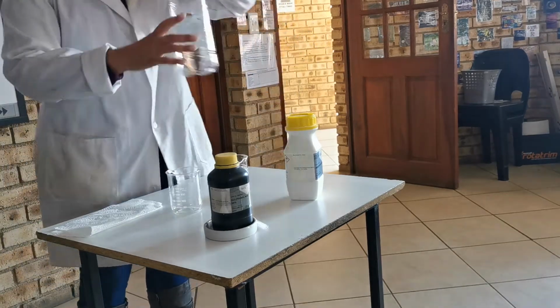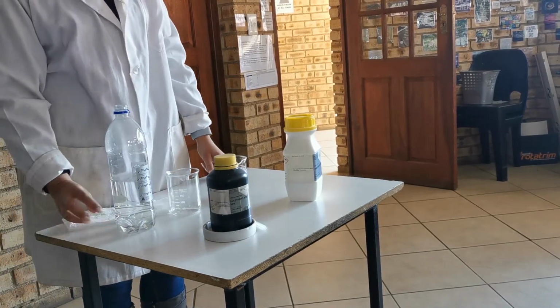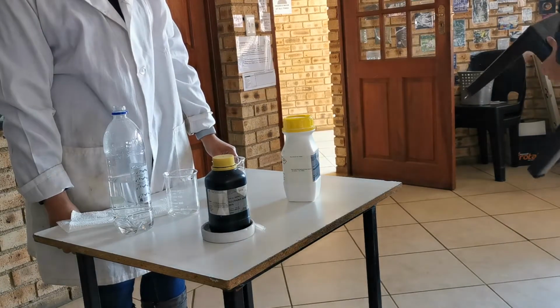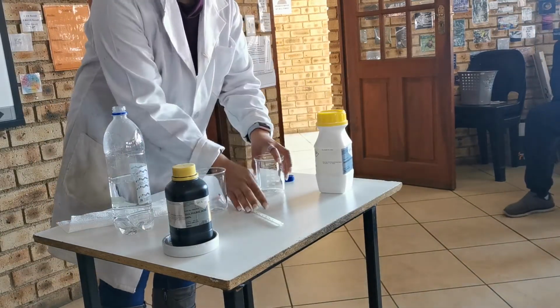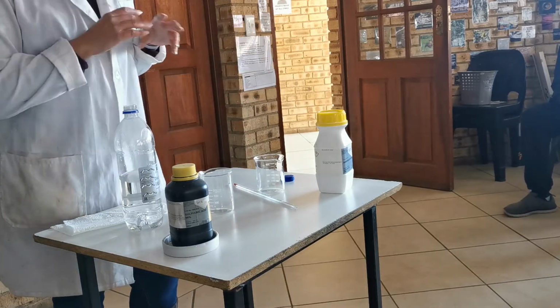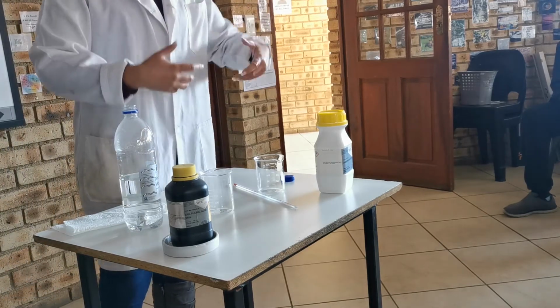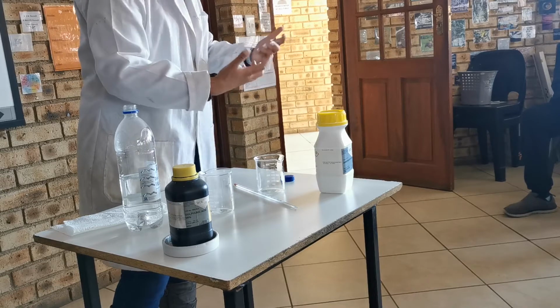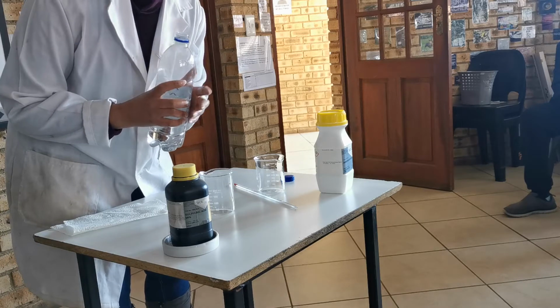So what I have is some distilled water. The first reaction that I want to do is show you an exothermic reaction. An exothermic reaction is one where heat is given off to the surroundings. That is the definition for an exothermic reaction, whereby we have a situation where there is surplus energy, and that surplus or extra energy goes to the surroundings. In this instance, our surroundings will be our water molecules.